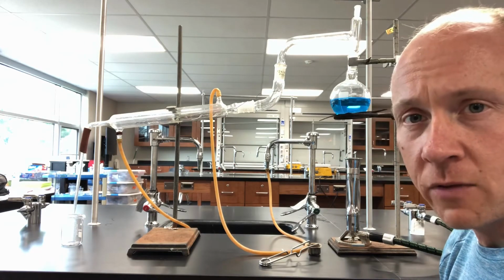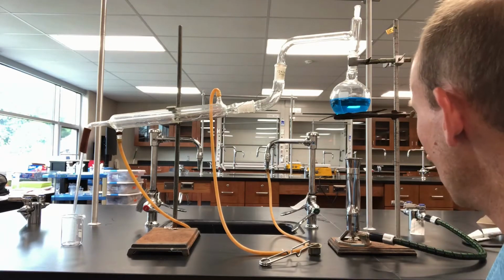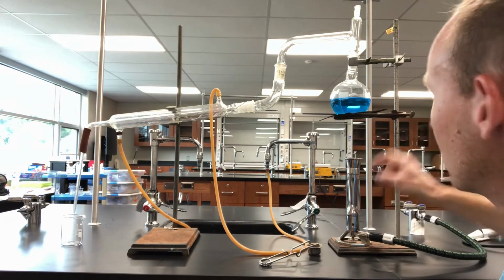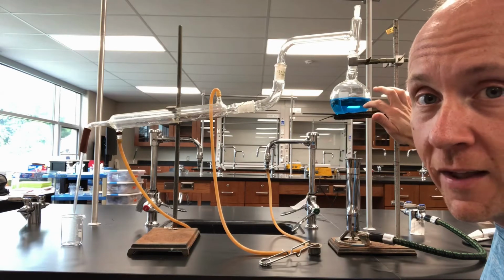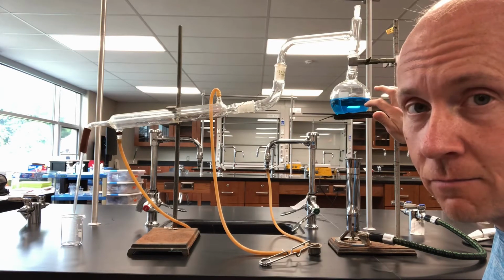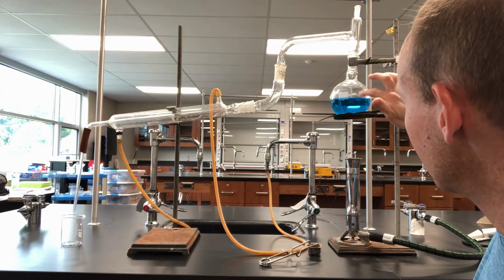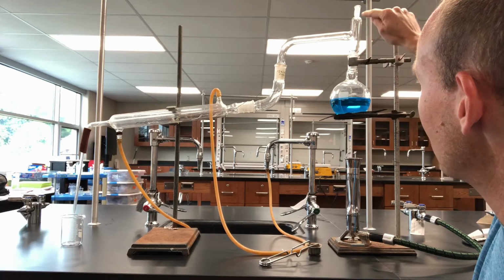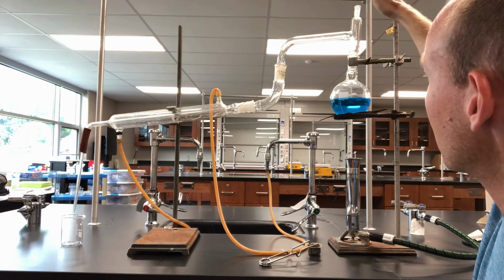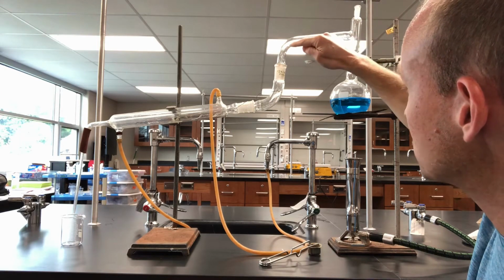And the way we're going to do that here in a few minutes is as follows. We're going to light our Bunsen burner, and it's going to start to heat up the solution right here. When it gets to 100 degrees Celsius, that's the temperature that water boils at, we'll start to have the water vaporize into steam, and it's going to start to find its way through this fancy glassware here. It's going to rise up here, and it's sealed off at the top, so it's going to be forced to go through this channel right here.